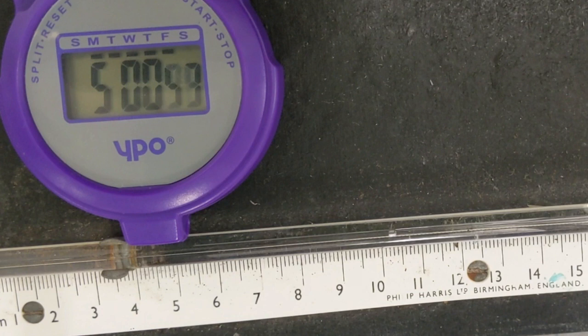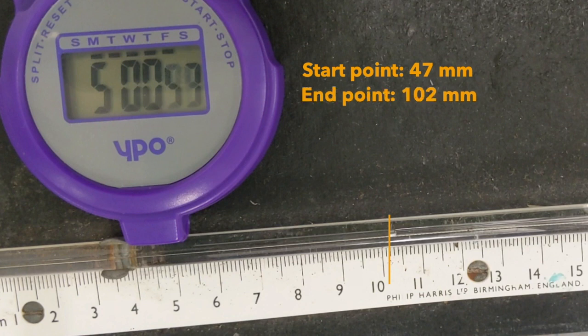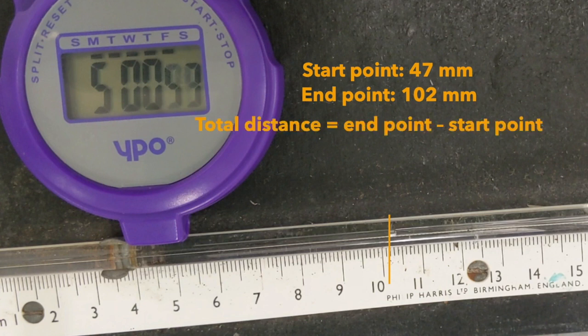At the end of our final experiment, the bubble is at 102 millimetres along the ruler. As with the previous experiments, we need to calculate the total distance travelled. The start point this time was 47 millimetres and the end point was 102 millimetres. Again, to find the total distance, you need to subtract the start point from the end point. So for this one, that is 102 minus 47, giving a total distance moved of 55 millimetres, so quite a bit further than the previous two experiments.